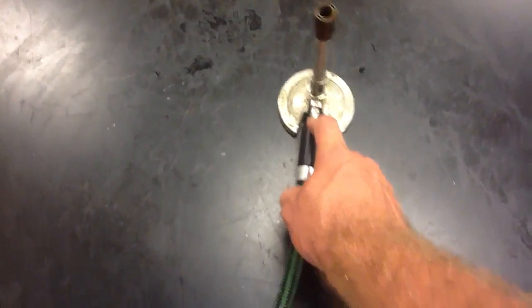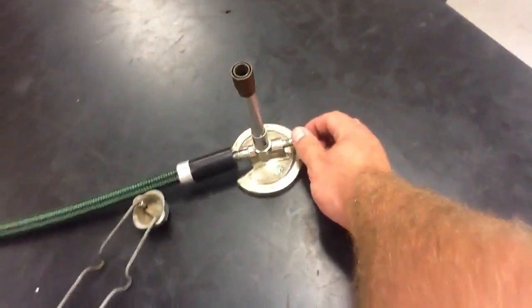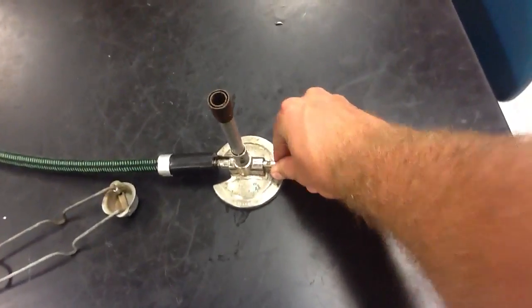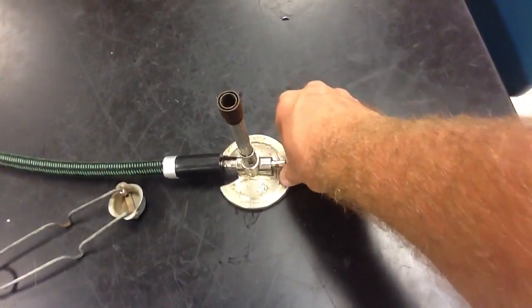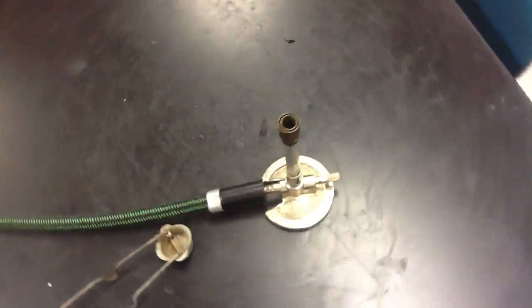The next thing you want to do is turn on this valve. Loosen it up until you hear and feel a slight breeze coming out of the burner.